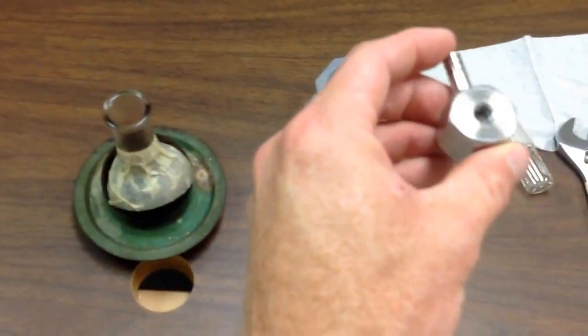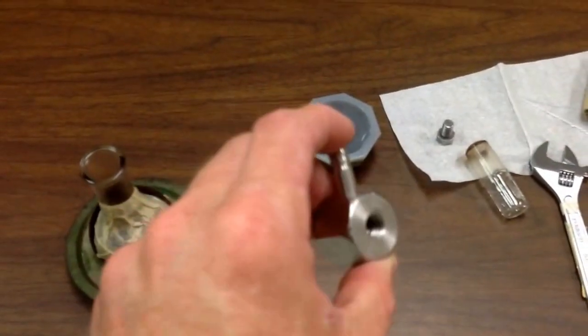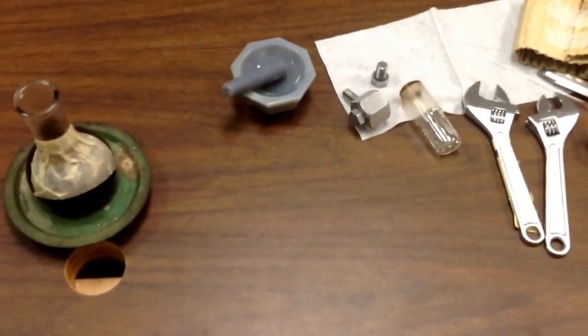So basically, this little device here, I'll show you kind of how to use. We'll have to use some wrenches. It's easier if you've got a hydraulic press to make your pellet.